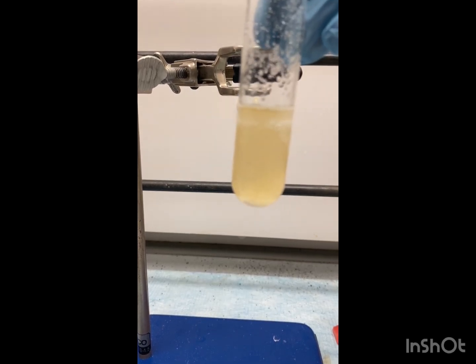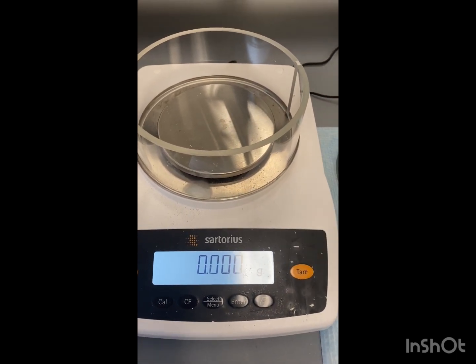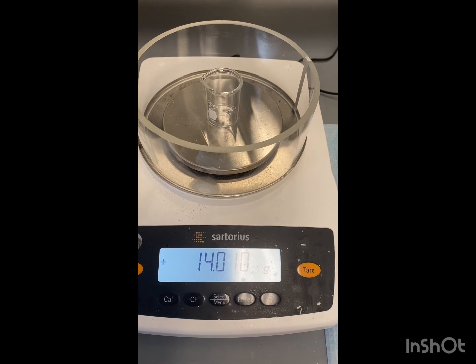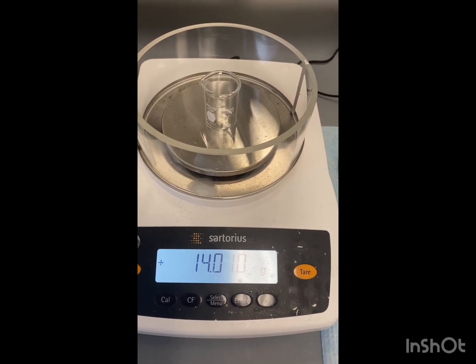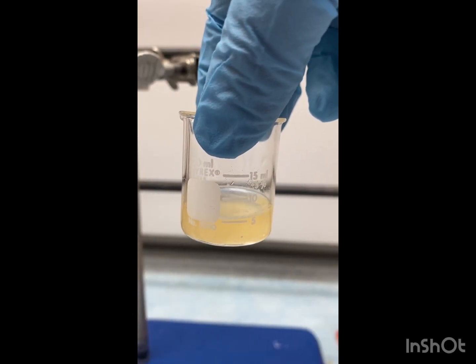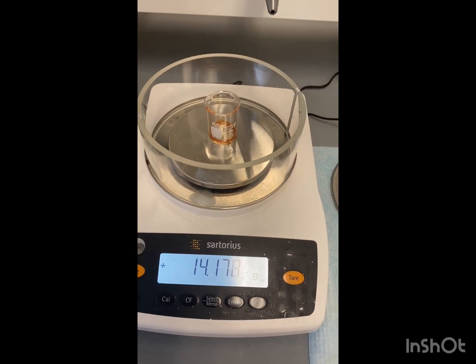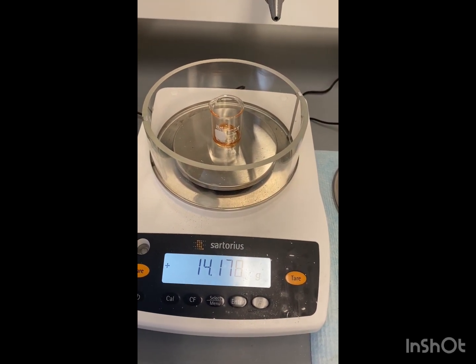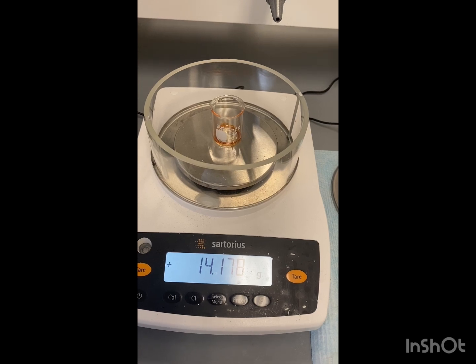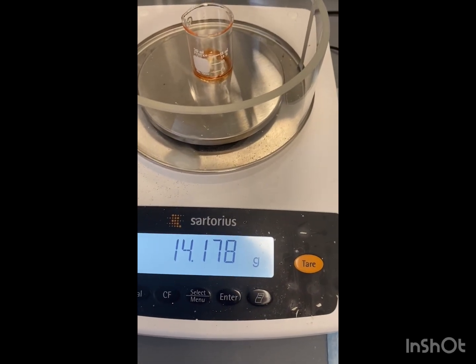Now we're going to decant it. Before we decant our product, I'm going to get a mass of the beaker I'm going to decant it into, so that when it dries we can get a final mass by subtracting that mass. We've decanted our liquid and now we're just going to dry off the DCM. Our product has dried and now we're going to get a final mass — 14.178 grams. We're going to subtract that from the mass of our empty beaker to get the final mass of our product.